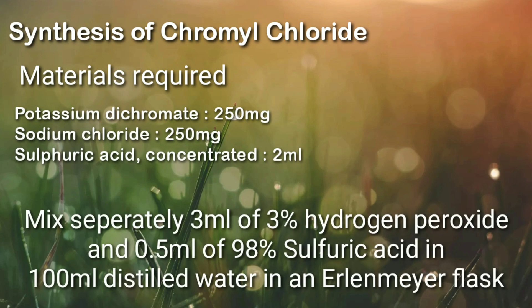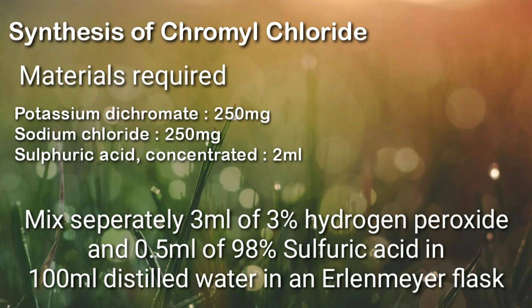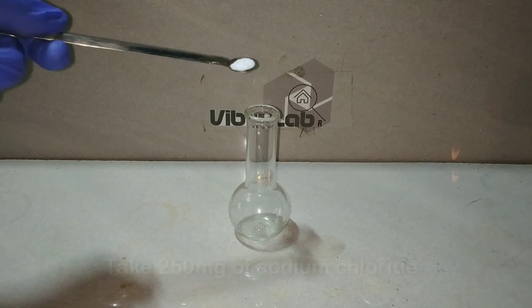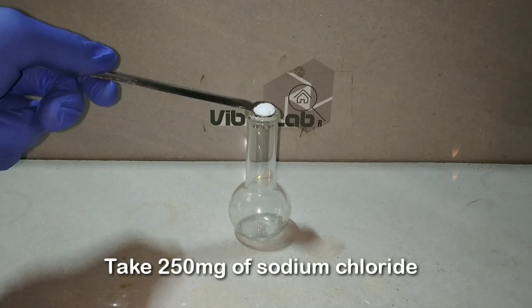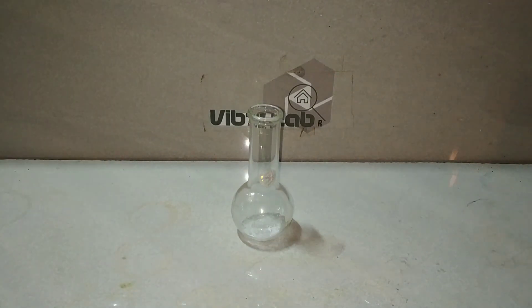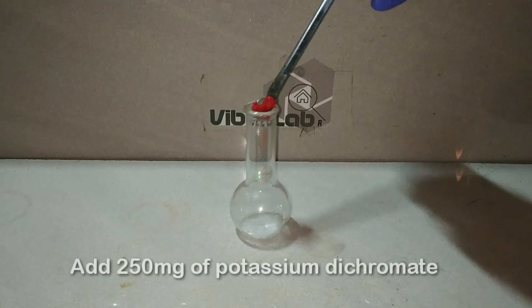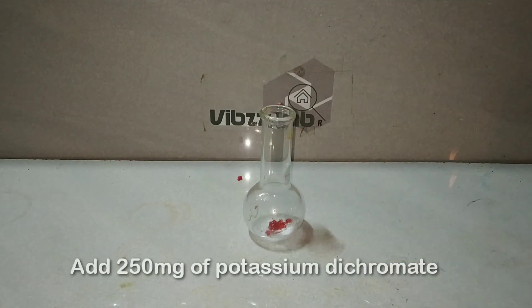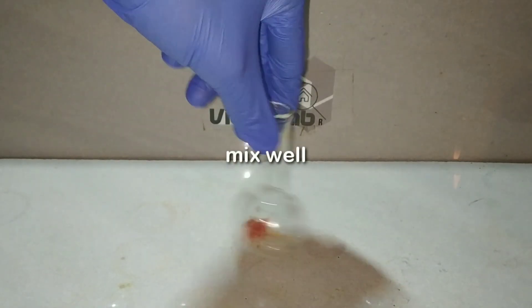For the synthesis of chromyl chloride we require three reagents: a dichromate salt — potassium dichromate — a chloride salt — sodium chloride — and concentrated sulfuric acid. First we would measure and take approximately 250 milligrams of the chloride salt and the same amount of potassium dichromate in a small glassware, then mix it well.